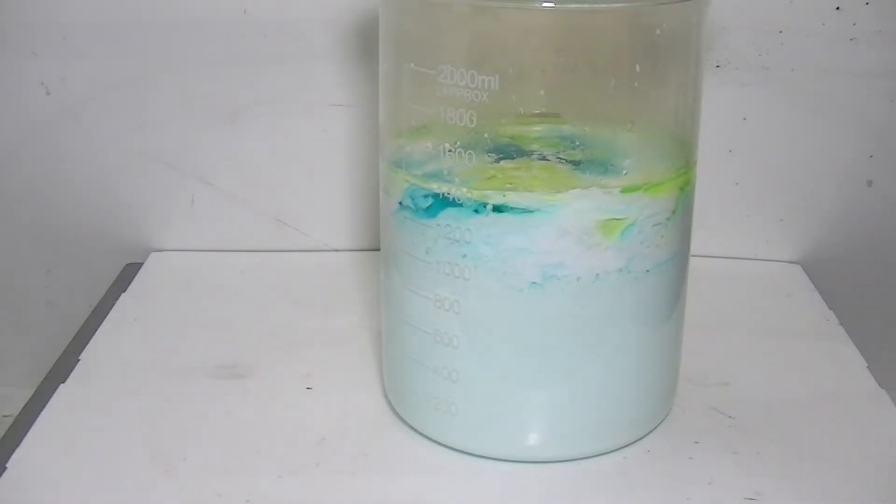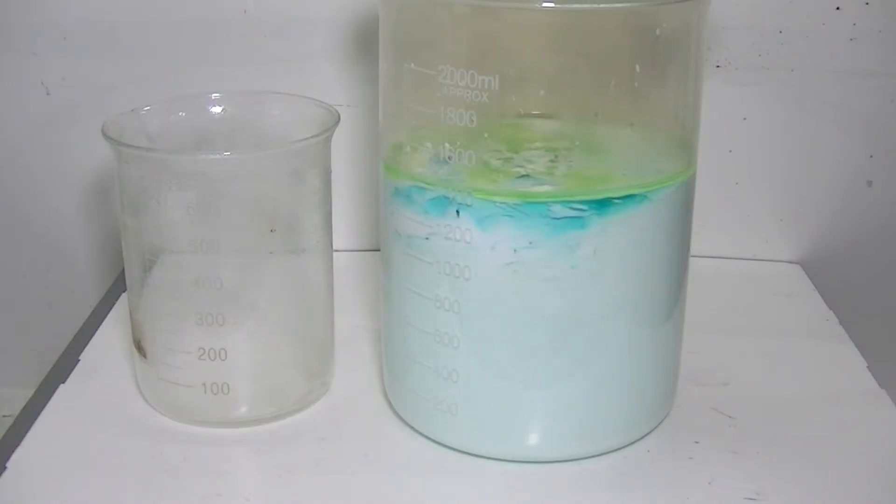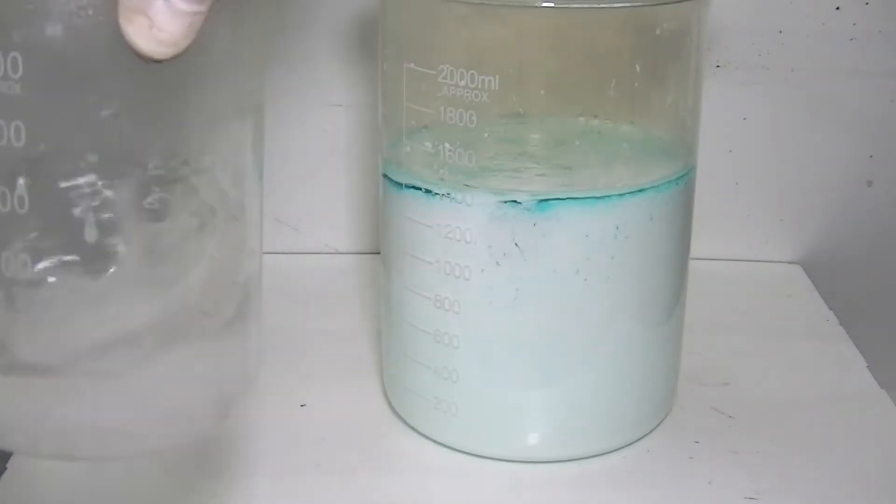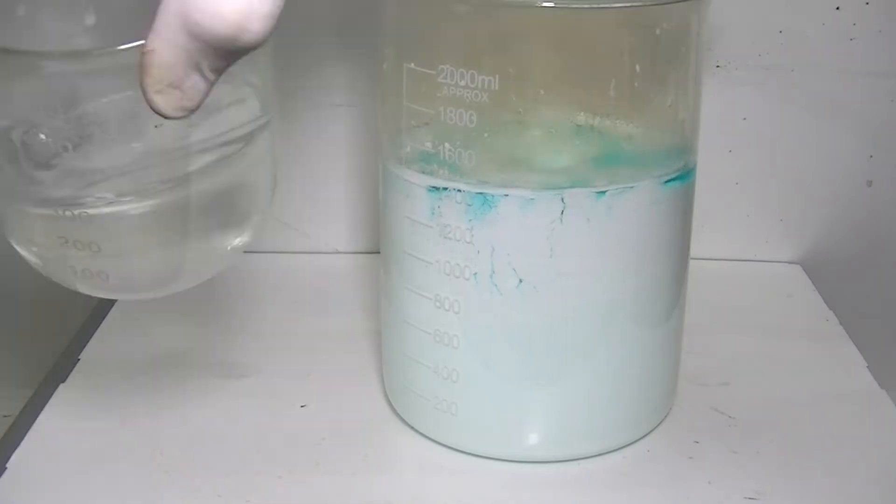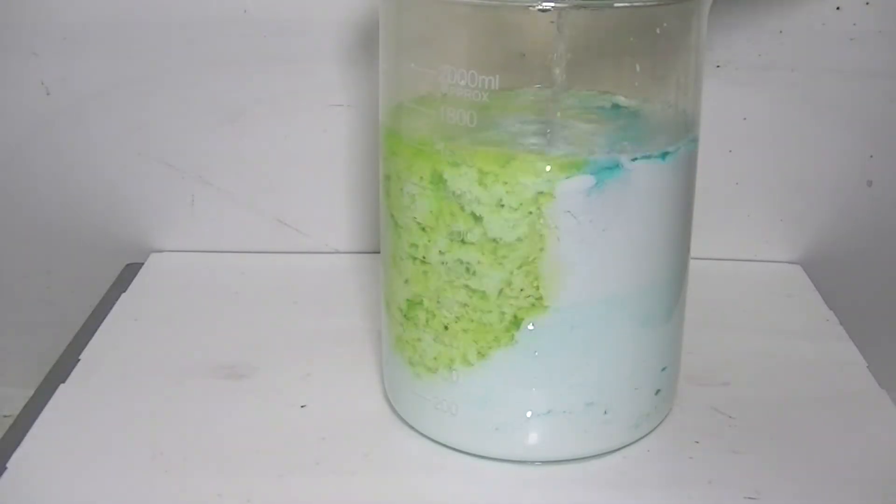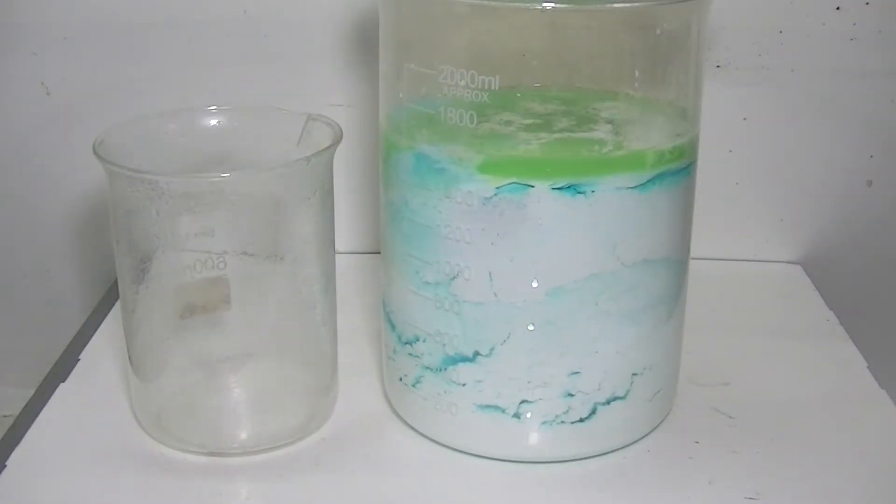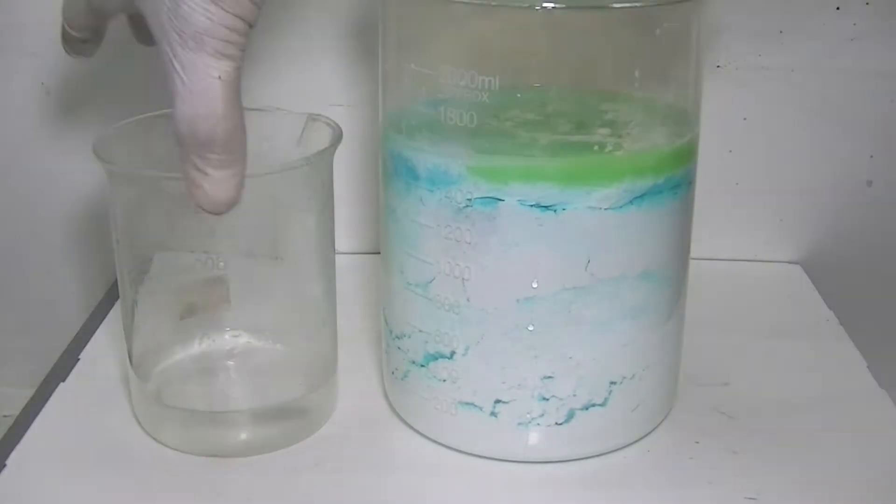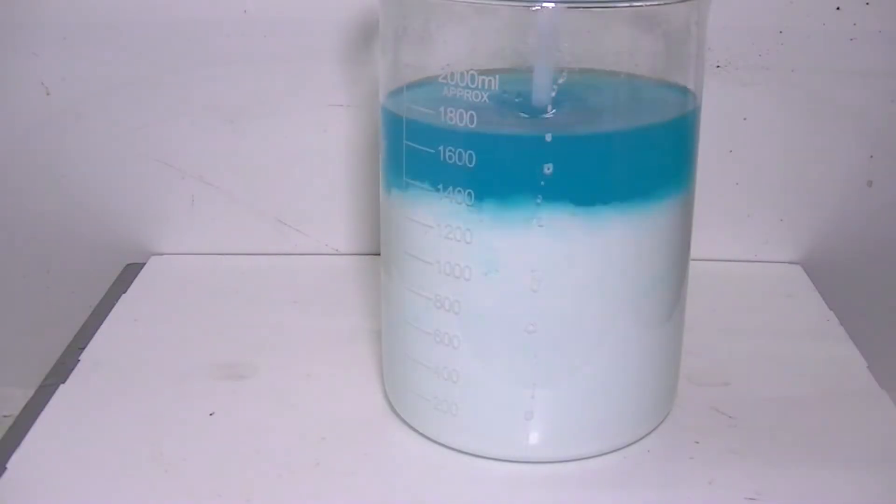Since the silver chloride sludge is quite thick and heavy, it was a bit tough for my magnetic stirrer and I really should have used my overhead stirring unit. I'll stir things up for a couple more minutes or so to make sure all of the silver has been precipitated. When that's done, it is left to settle.